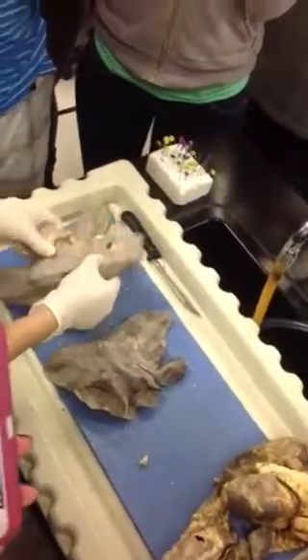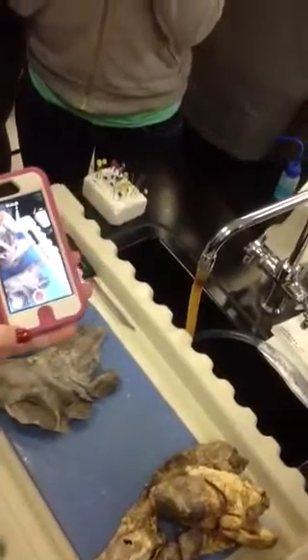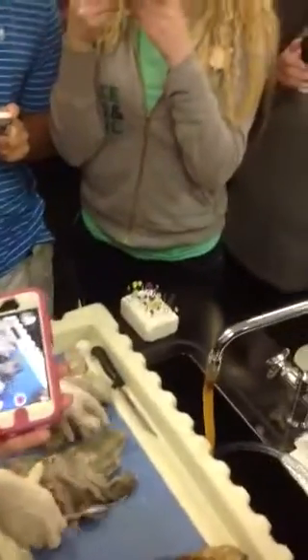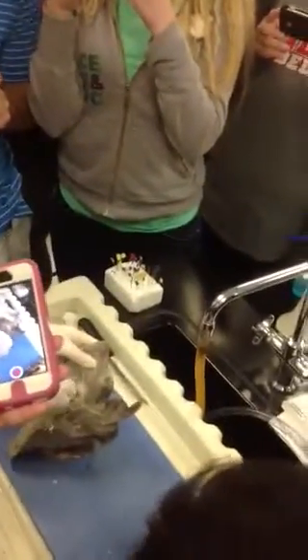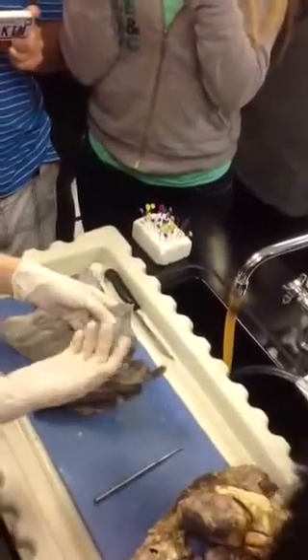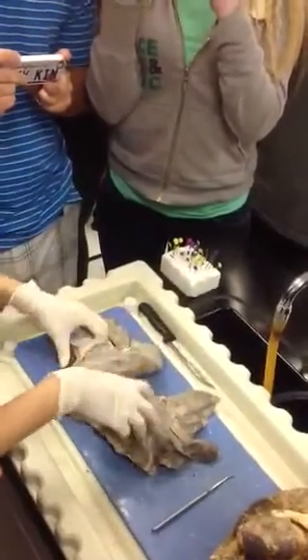So on either side, we have a primary bronchus. Here's one, and if you have a glove, you can feel it. Okay, and on the other side, we have another primary bronchus. Okay, and it still has that hyaline cartilage feel to it because it's still kind of a part of the trachea, right? Okay, so let's again orient ourselves.